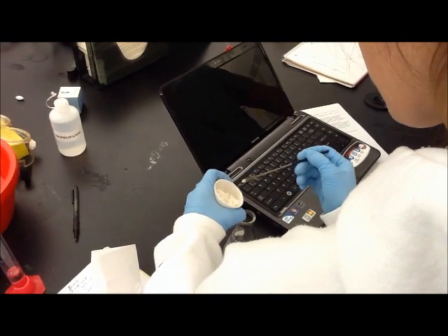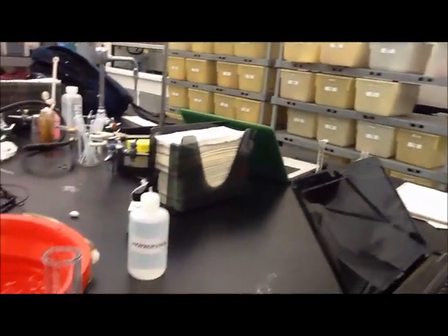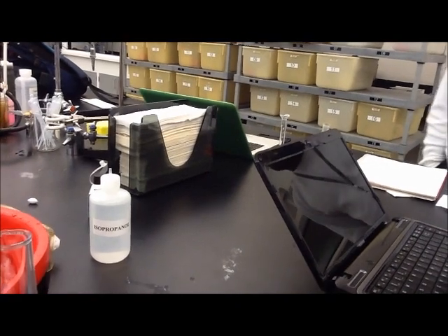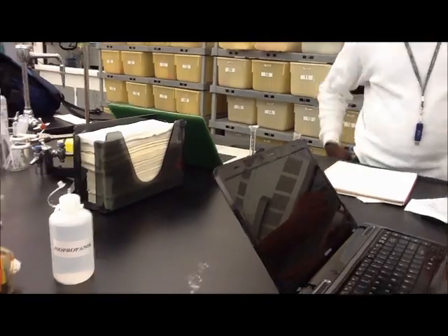Now we're going to mix this with hot ethanol. We need to heat up ethanol and recrystallize from it. We'll add as much as needed to dissolve this, and then crash it out again.